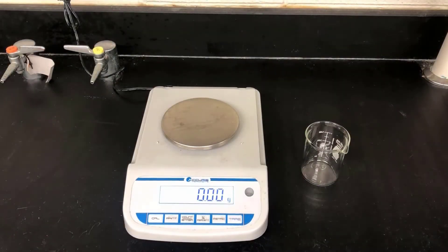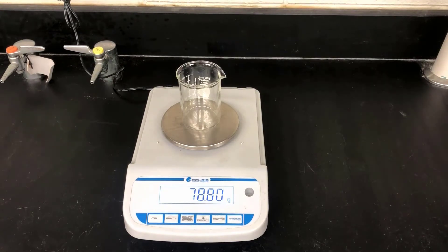Here I'm pre-weighing a clean, dry 150ml beaker. I'll use this mass later to get the mass of the caffeine sample by difference.